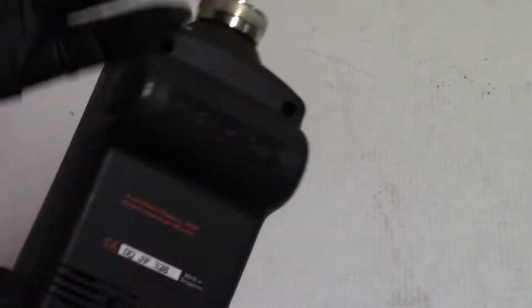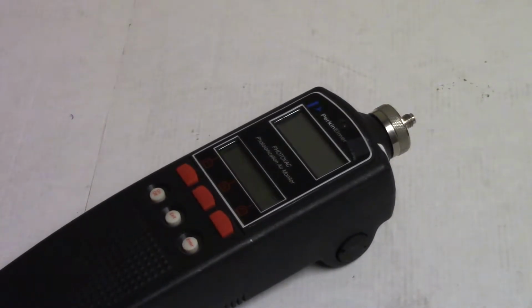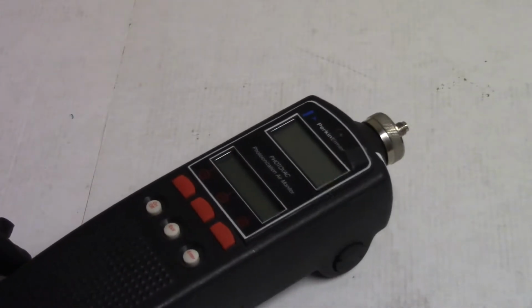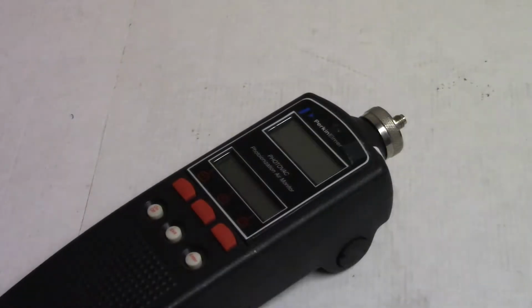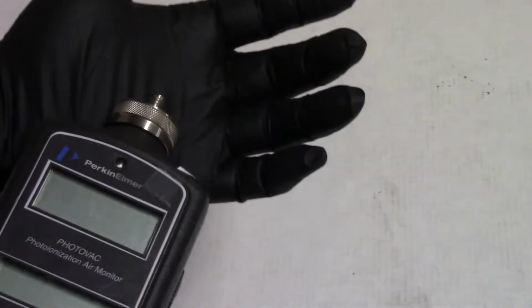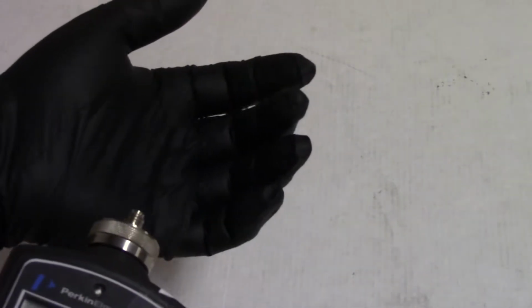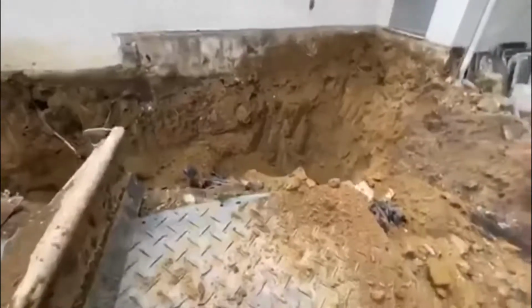So in the situation where I see this used, the guys are looking for heating oil that leaked into soil. They want to see when that amount of heating oil has dropped below a certain threshold, depending on where they're doing it. So they'll take a clump of dirt that they want to sample. They'll start with an obviously contaminated sample, and they work their way down to the uncontaminated, or as least contaminated as possible. We've removed the tank, cut it in pieces, looking for our start point.